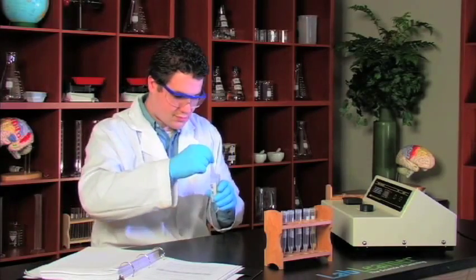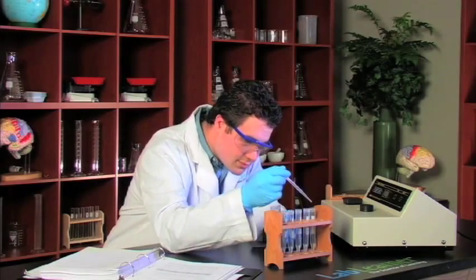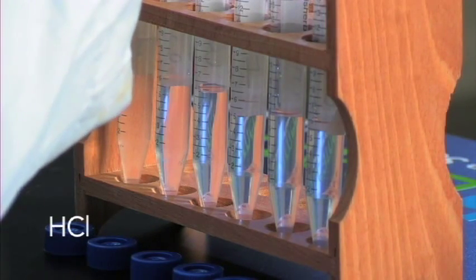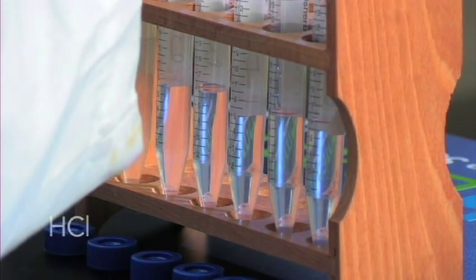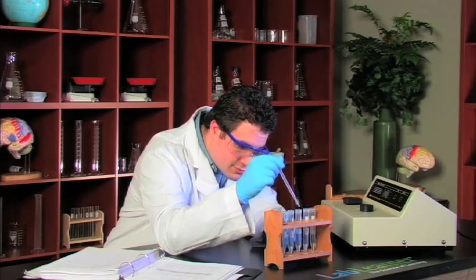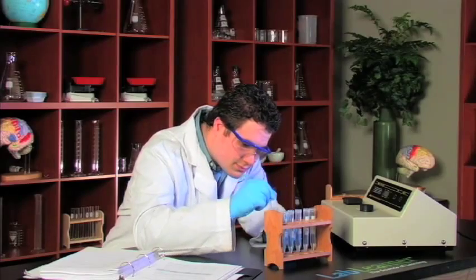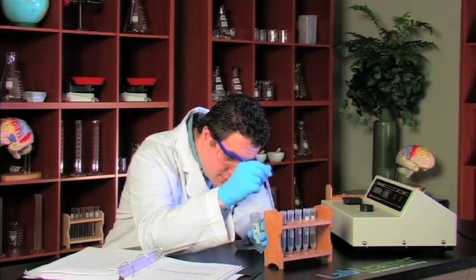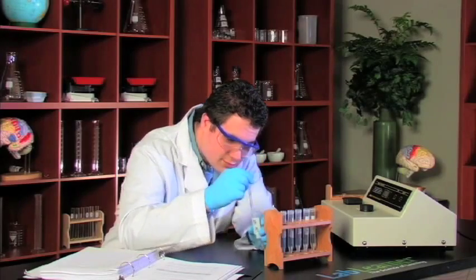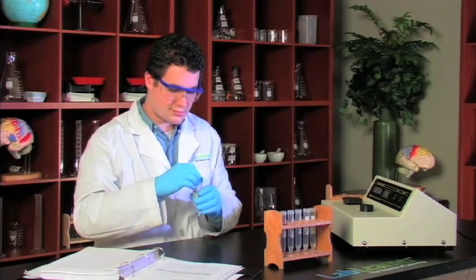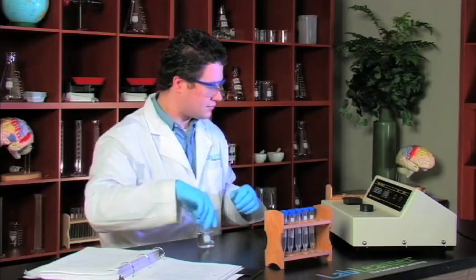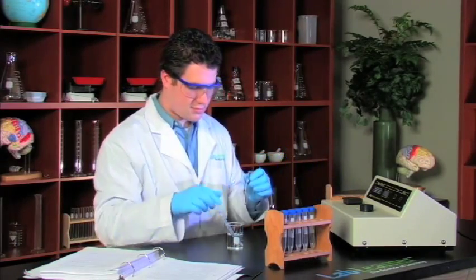Now comes the HCl, the hydrochloric acid, and we'll add the same amount of HCl which is a catalyst in this reaction to each of the tubes, and that is two milliliters. So he's taking each of the tubes up to eight milliliters by adding the hydrochloric acid. The next reactant that we would add would be iodine, and iodine will react immediately and as it's used up it'll begin losing its color. We're going to look at that loss of color in terms of absorption in the spectrophotometer.